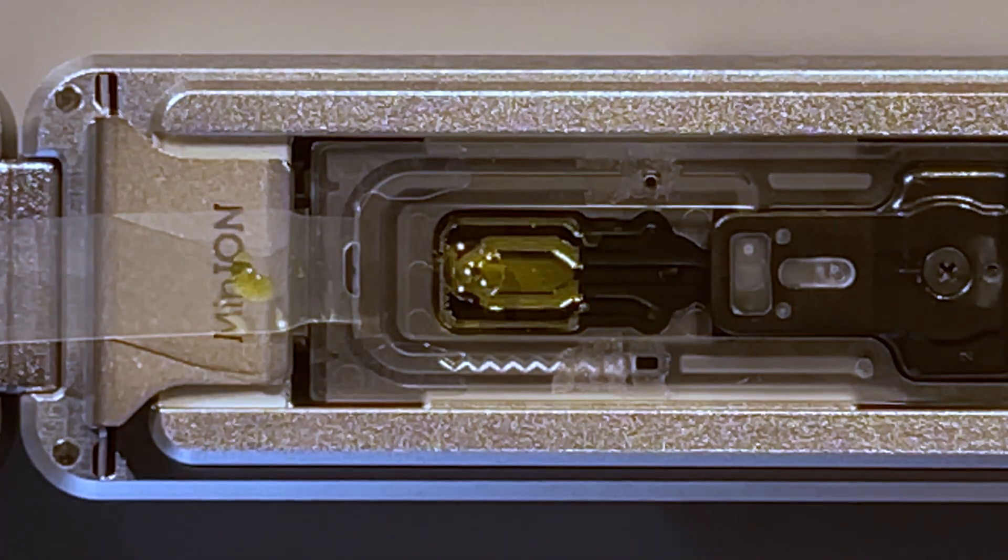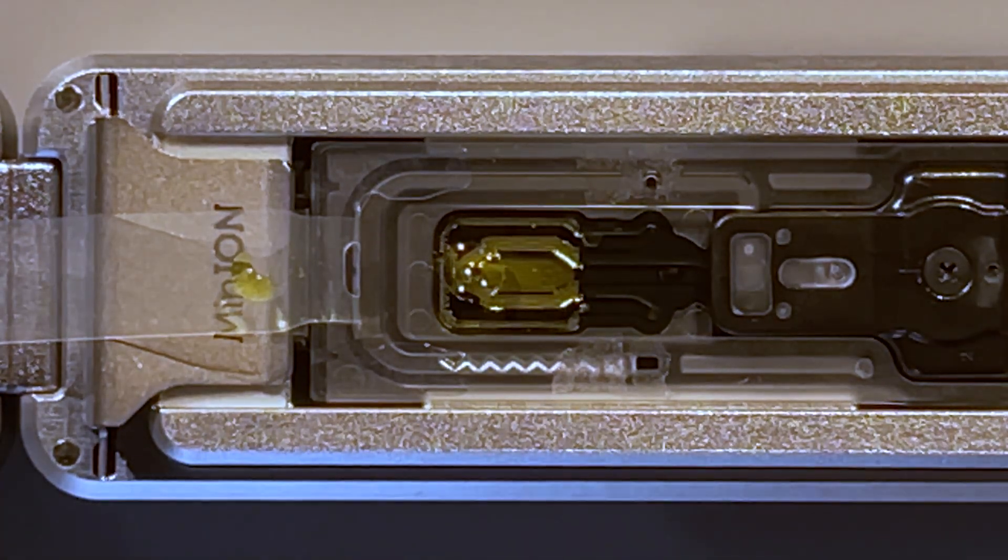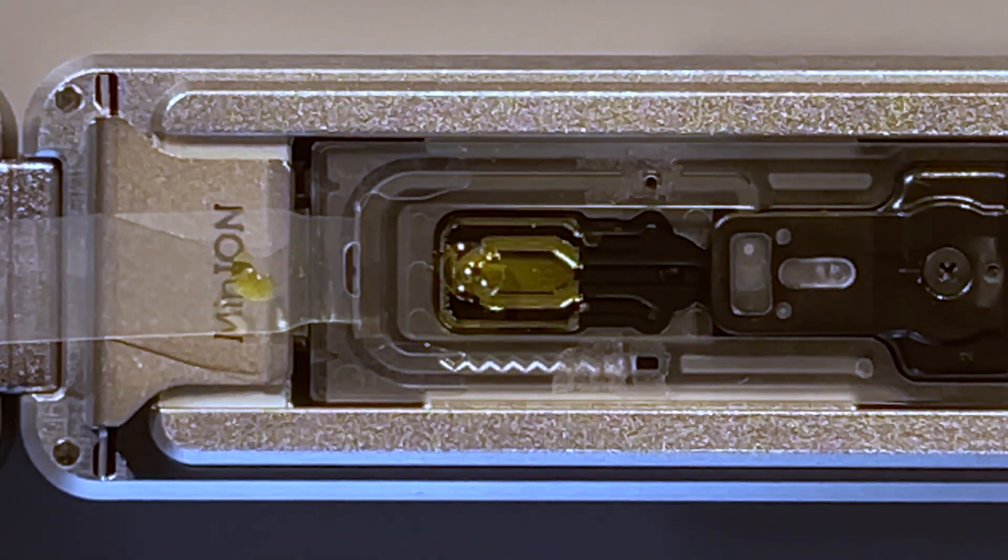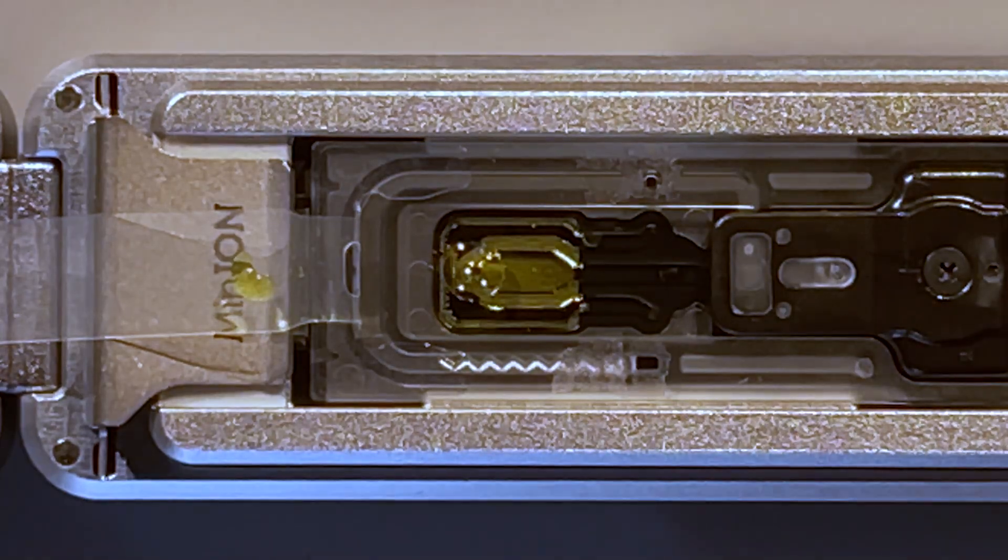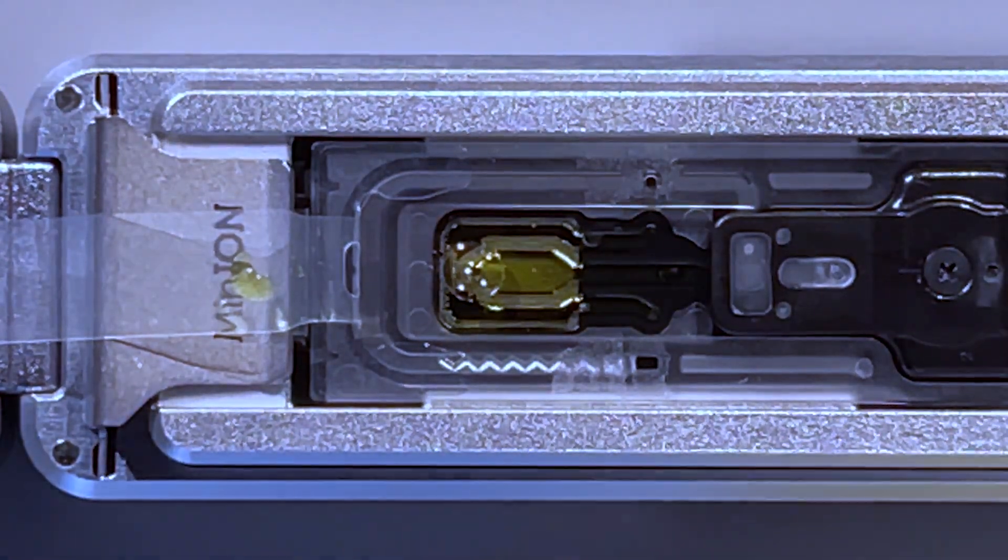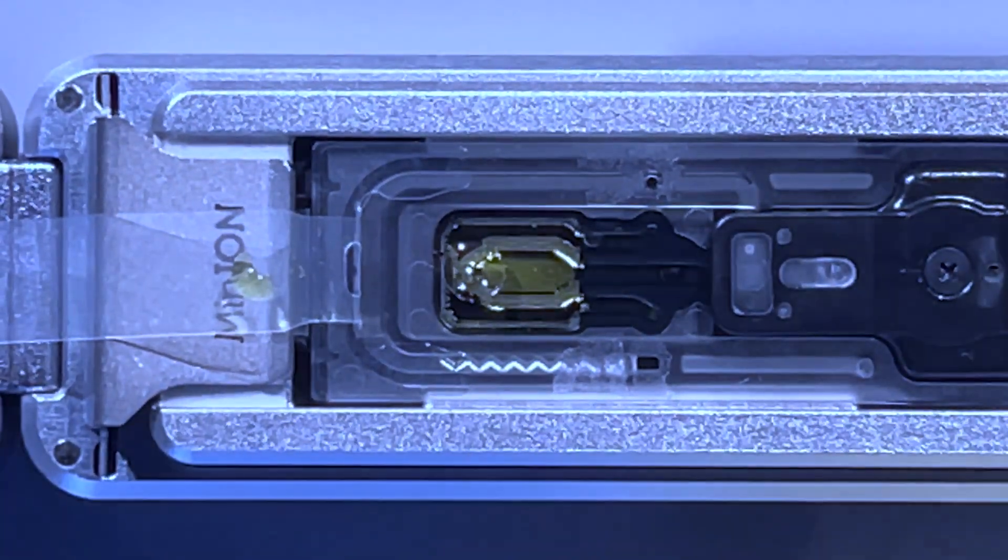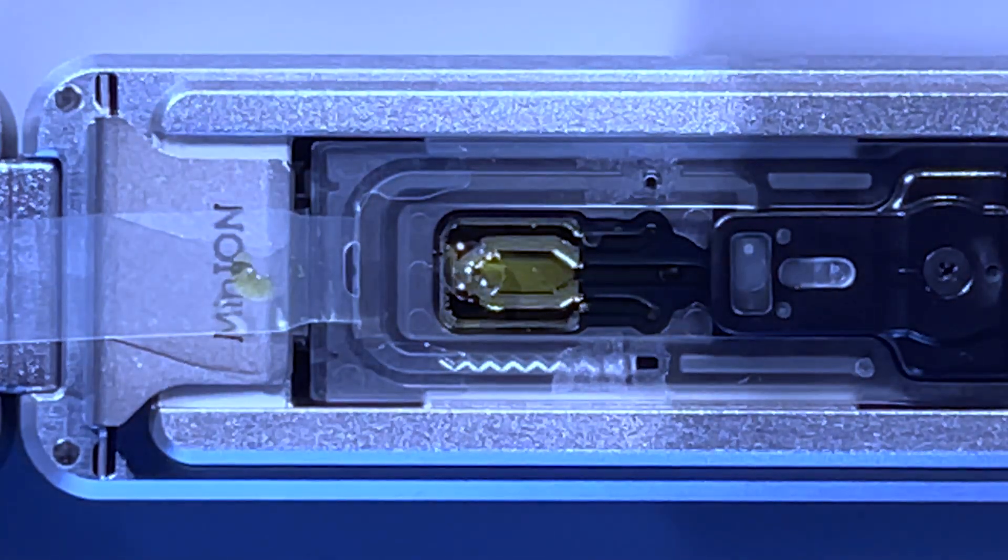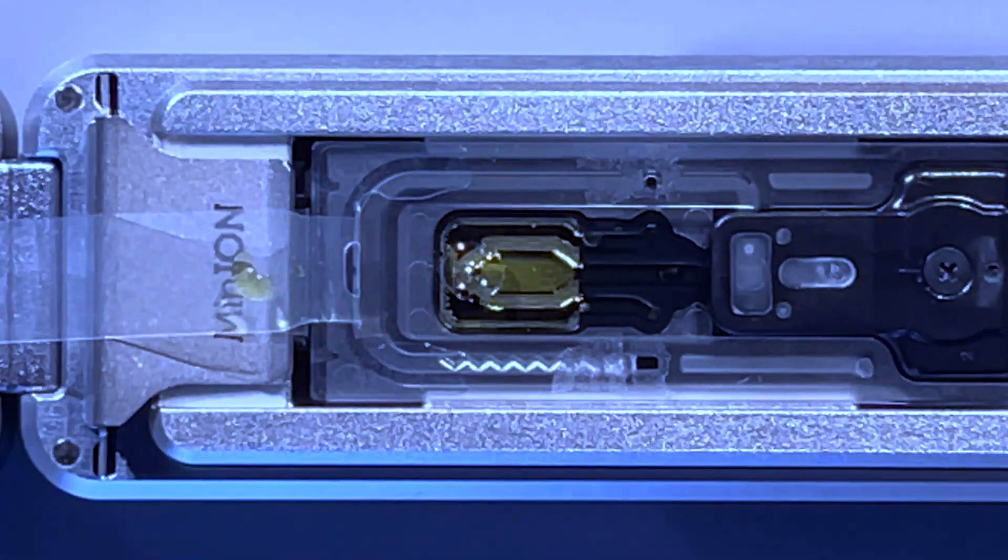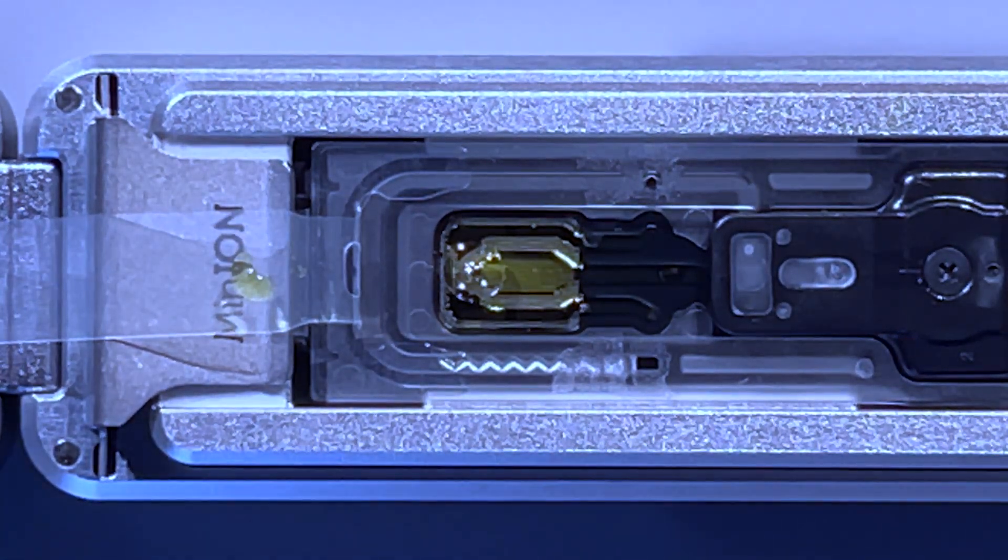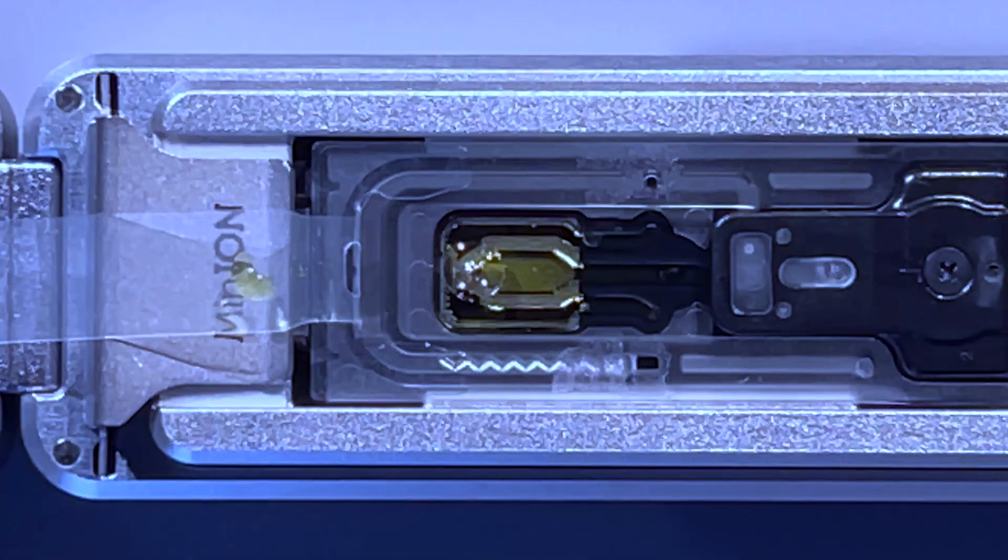So that little window here—got a bit of a glare—but that's where the sequencing happens or where the nanopores are located. But just above it is a little hole there, which is where I am going to go ahead and start loading. So according to the instructions here, I want to disperse 120 microliters of that, and I need not the blue pipette but the yellow pipette.